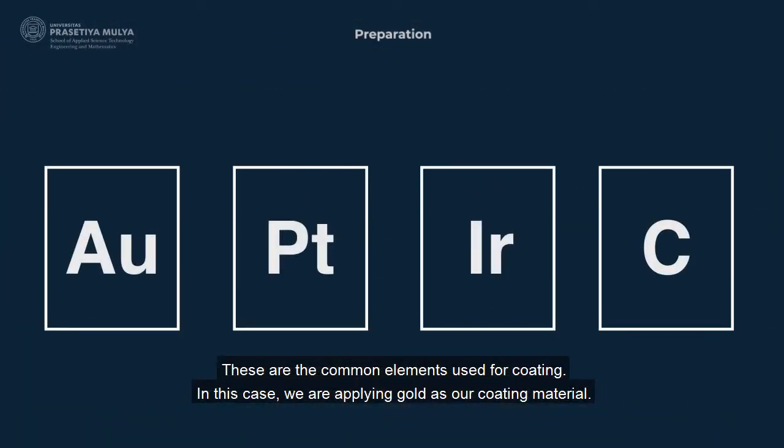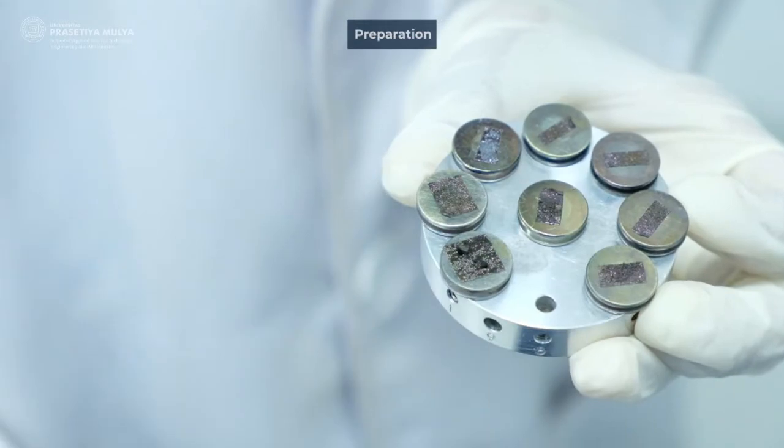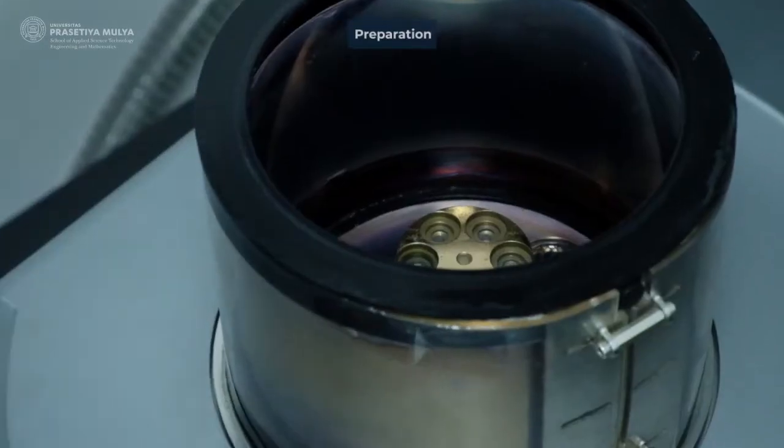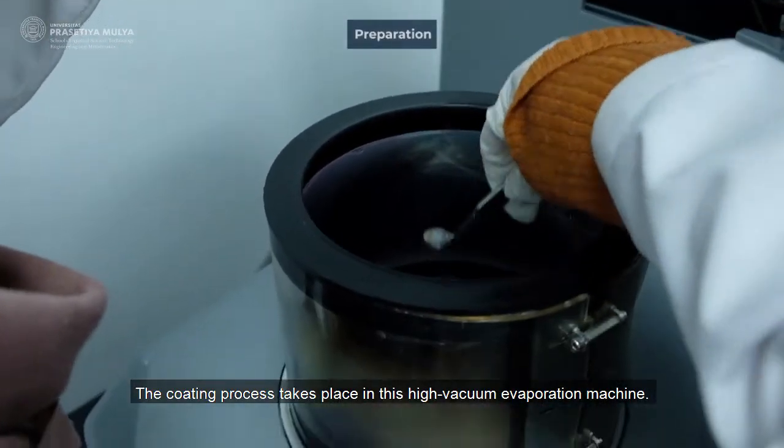These are the common elements used for coating. In this case, we are applying gold as our coating material. The coating process takes place in this high vacuum evaporation machine.